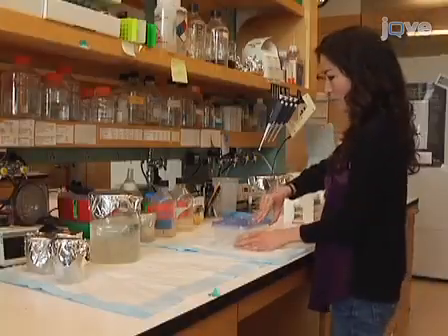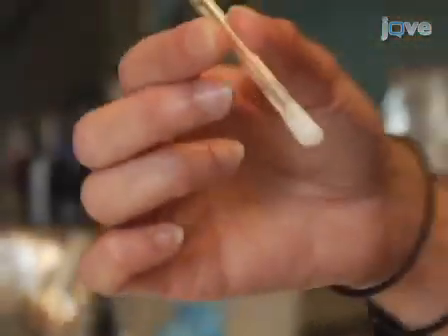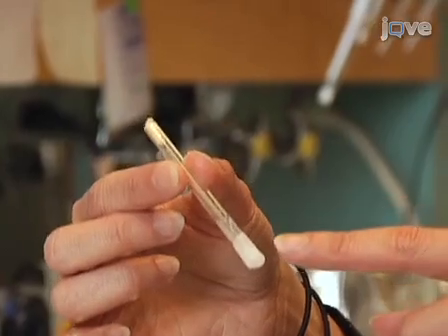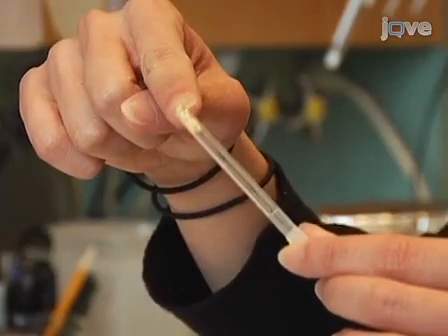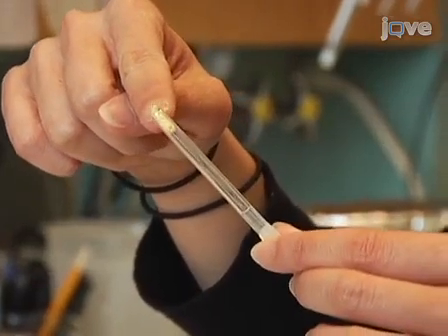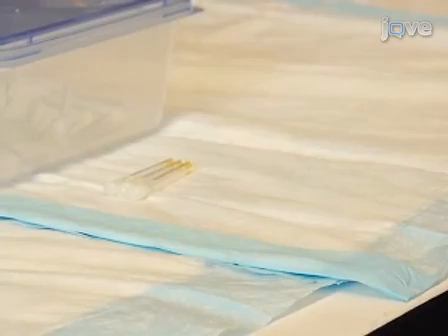Activity tubes represent the fly habitat during the experiment. They are thin, 5mm glass tubes that contain food substance at one end and are plugged with yarn or a plastic plug at the other end. It is preferable to use activity tubes that are freshly made. They are generally prepared a few days to a week ahead of starting the experiment.